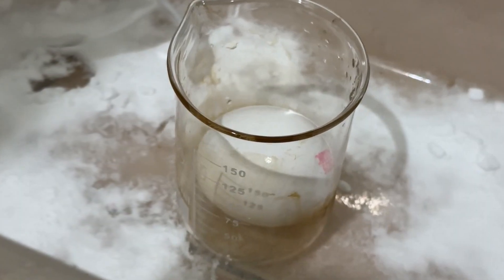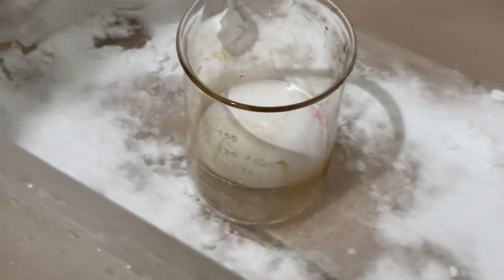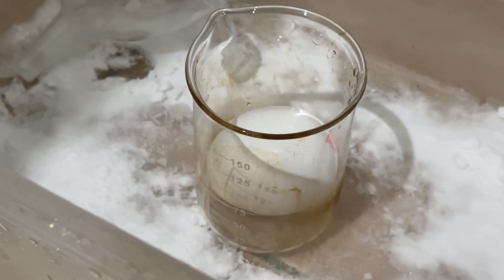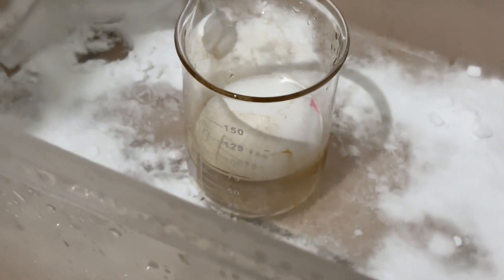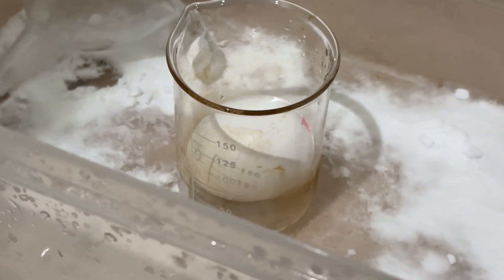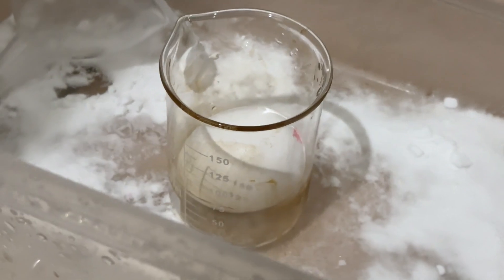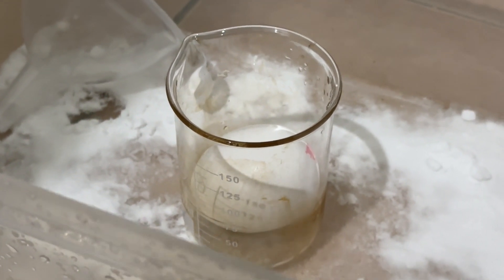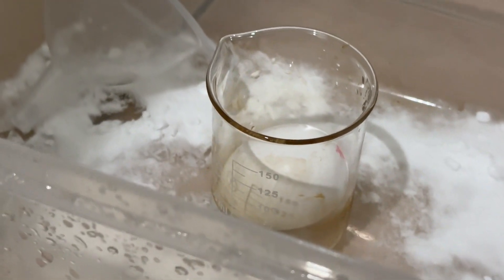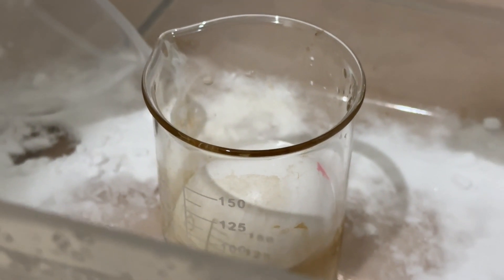We're back to eggs. What I have is pure — as high as it can get without fuming — 32% or 10.2 mole hydrochloric acid. I thought for funsies we'd see what it does. Last time I put a few drops on the egg but did not completely submerge it. We did 5 moles and that was fun. This here is 32% — not 32 moles, 10.2 moles.